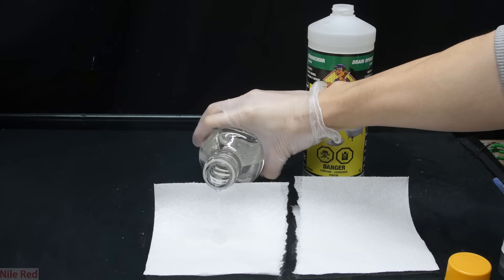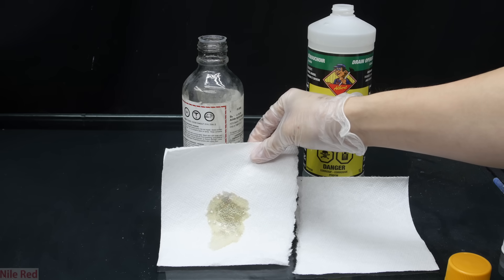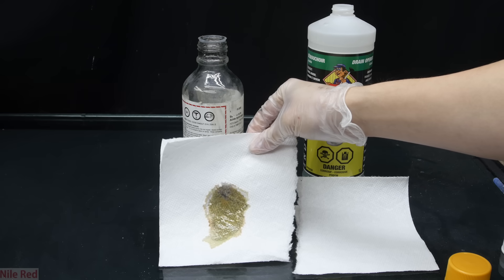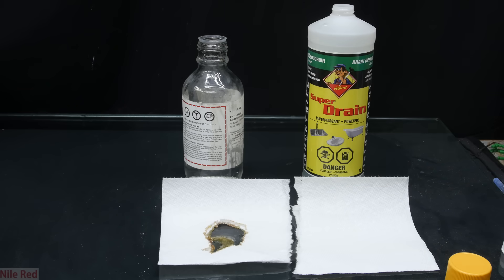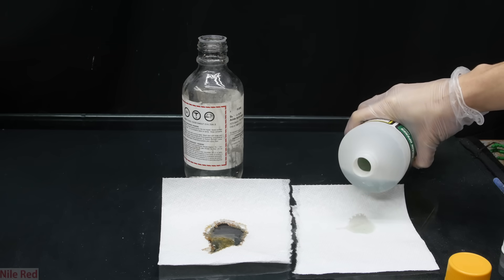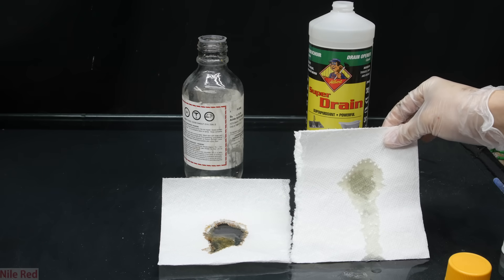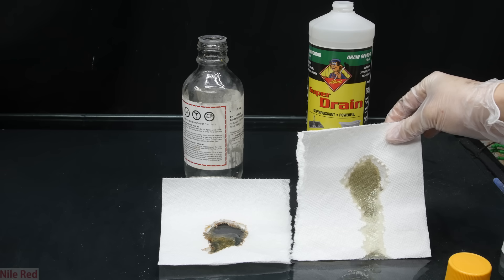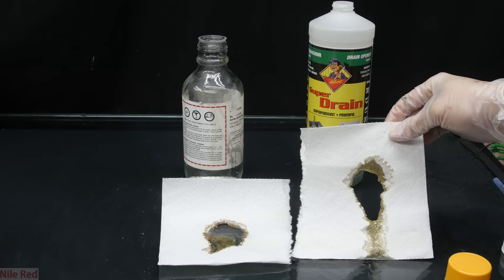We start with the concentrated sulfuric acid that we distilled — once poured on the paper we start the timer. From the moment the sulfuric acid was poured onto the paper to the moment it disintegrated, it took about 14 seconds. Then we try it with the lower-concentration drain cleaner — for this lower-concentration run, it took about 20 seconds, so almost 50% longer.